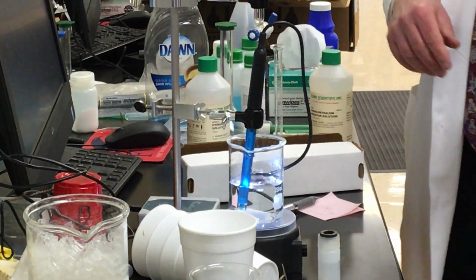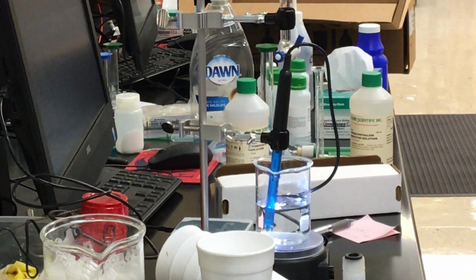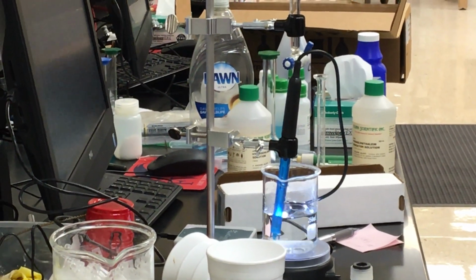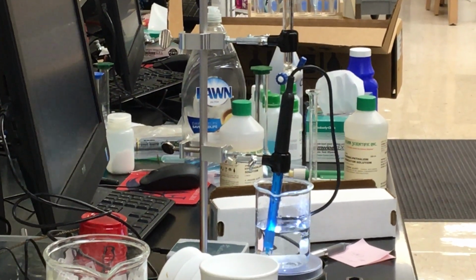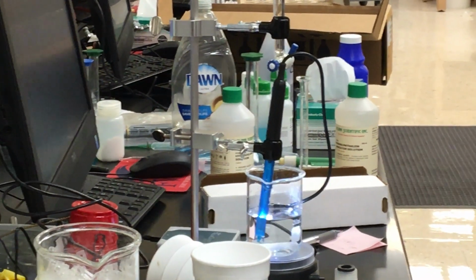There we go. Okay, I'm starting to see a little bit of an increase. Will it turn pink really quickly?